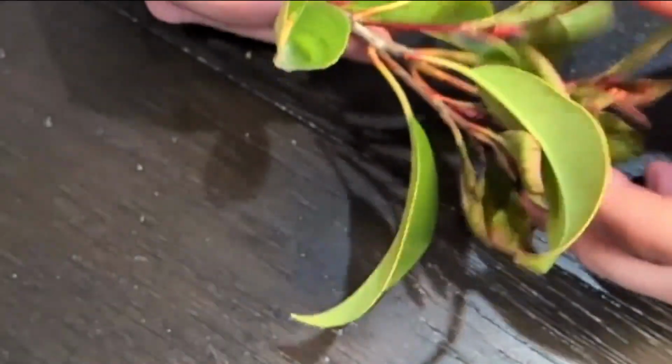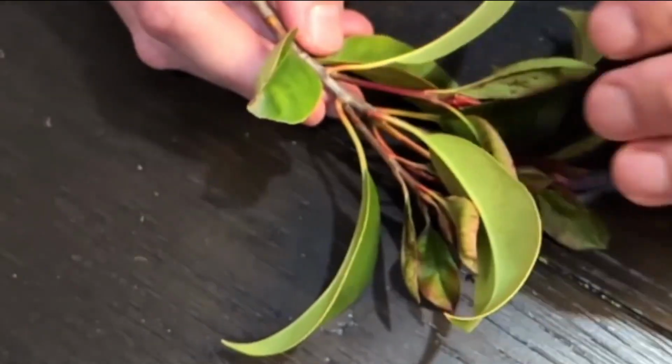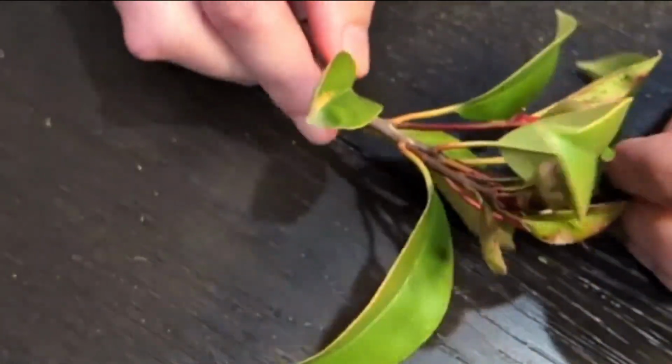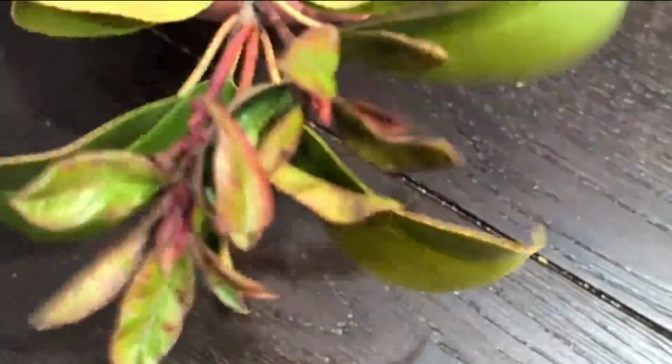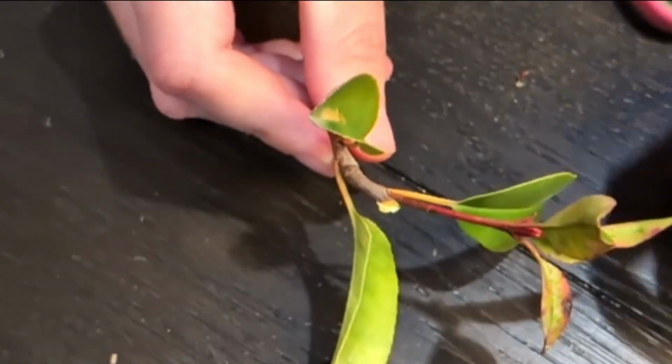Okay, so to understand the anatomy and characteristics of leaves, we're going to move through several different attributes. We're going to start off with the leaf anatomy. So here I just ripped off a twig of a shrub nearby. And I'm going to cut, just for ease of view, the tip of it, but know that the rest of it was still there. So I cut the tip of that twig off.